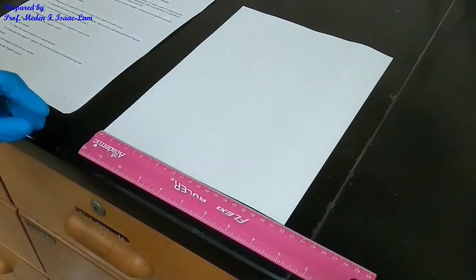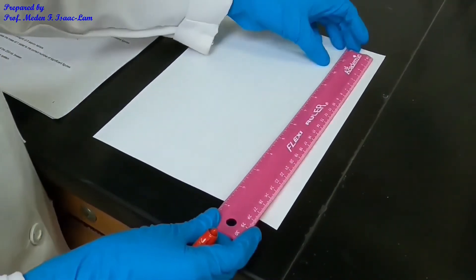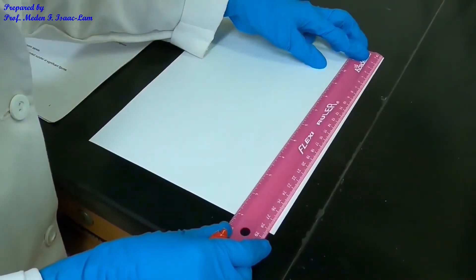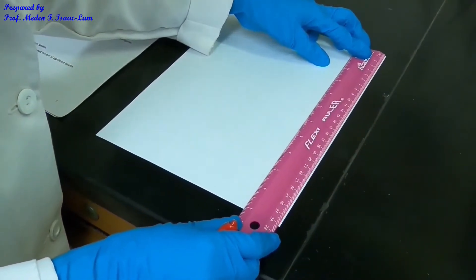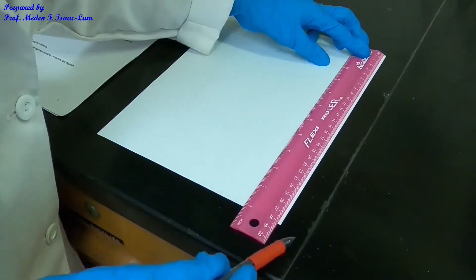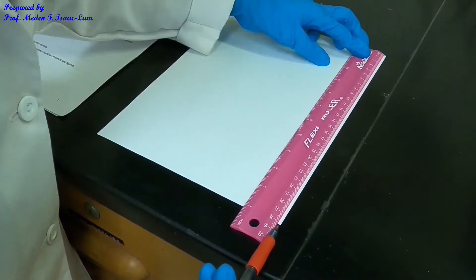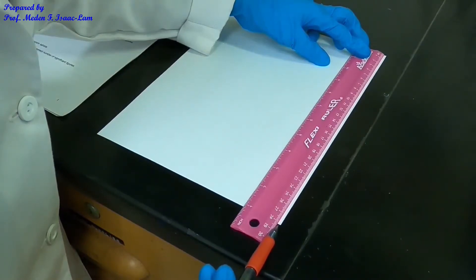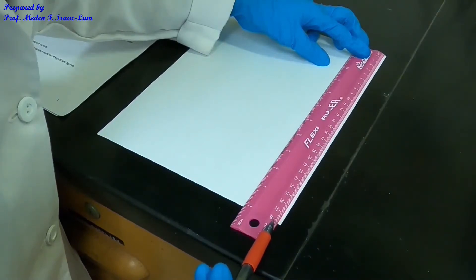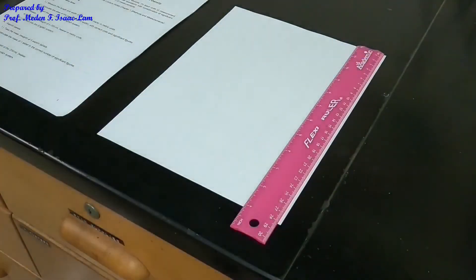You can also do this at home. Now I'm going to measure the length — I put the ruler from the top to the bottom. I'm measuring the length of the paper. It's not quite at 0.1, so I would say it's 28.08. That's the first part.